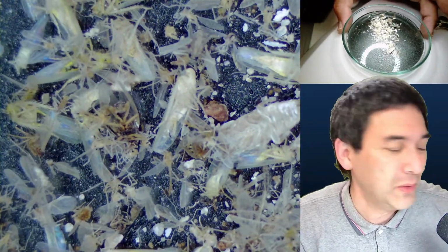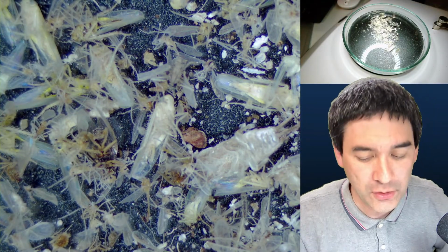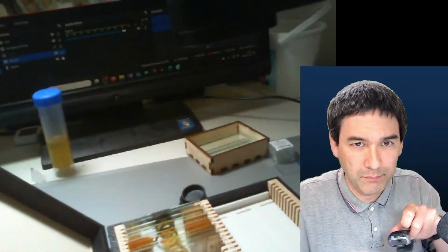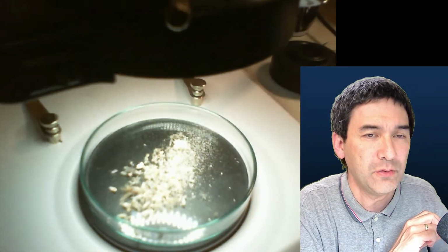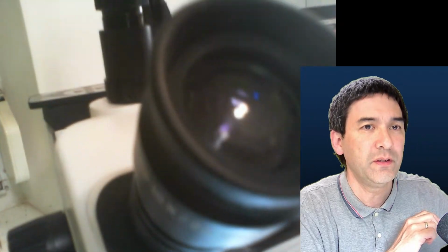I just wanted to also show you the new setup, and then before we actually start looking at some of the slides, I do have another camera connected here, which allows me to, okay, I bumped it, which allows me to have it in my hand. So that's the software that I'm using, and I just would like to show you the new setup that I have. That is basically my stereo microscope with a ring lamp. Okay, so far nothing unusual.